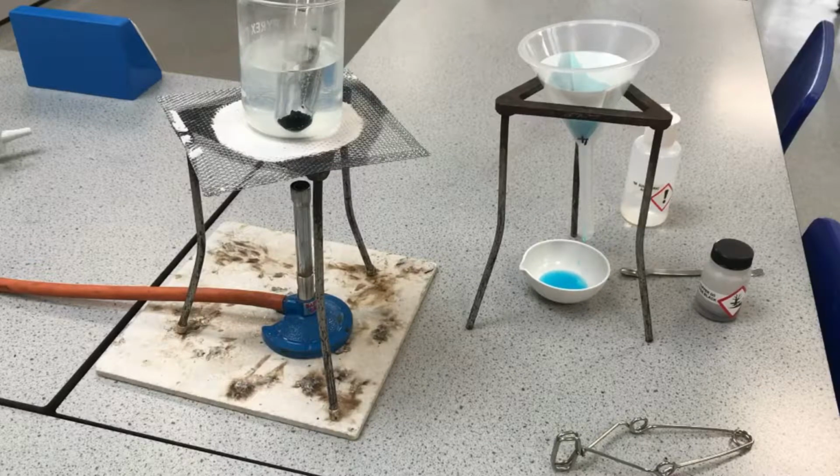I could heat it over a beaker of hot water, which would just gently heat it. The danger of heating it just straight away with a Bunsen flame is it's probably going to burn, but I'm also going to be stripping it of all the water. I'm going to end up making anhydrous copper sulfate, which is a white powder, and I just want to get some nice copper sulfate crystals. So I'm going to leave that overnight, and hopefully we'll have some crystals to see tomorrow.